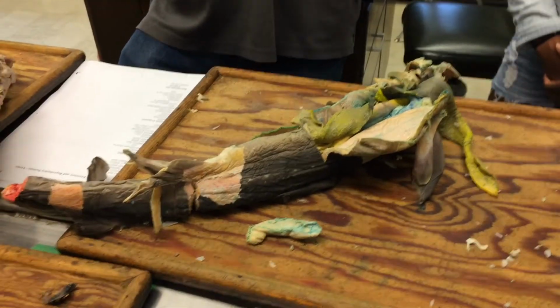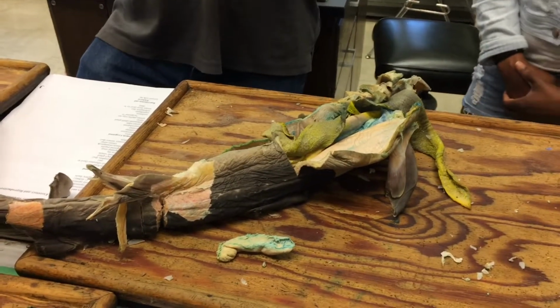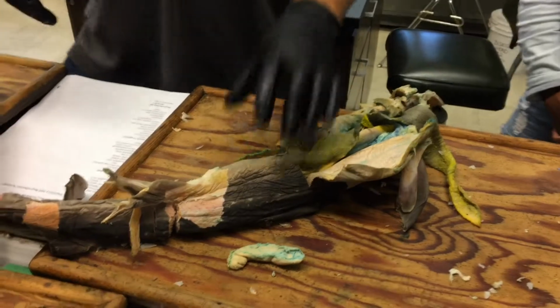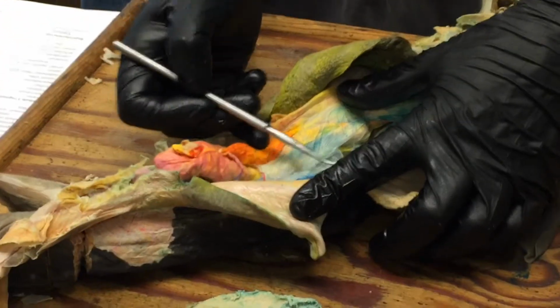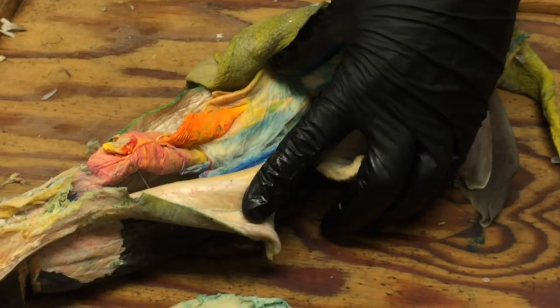Retroperitoneal is a term we apply to where the kidneys are. And what does that mean? Behind, and the peritoneum is the serosa. So they're behind the serosa. And that just refers to the fact that when you look into your shark, the kidneys are not hanging out. They're just buried behind the serosa on the dorsal body wall. Okay. So that's their position.